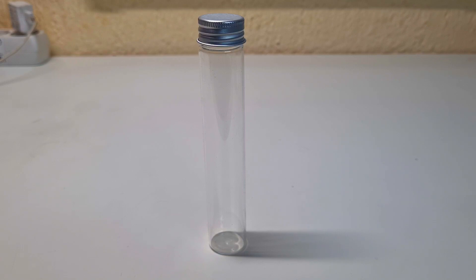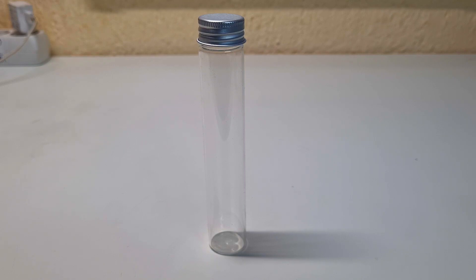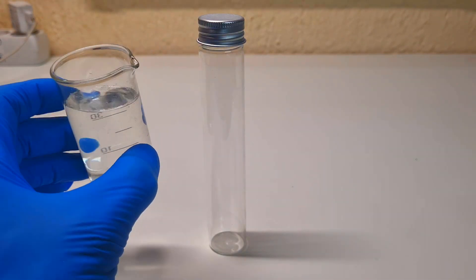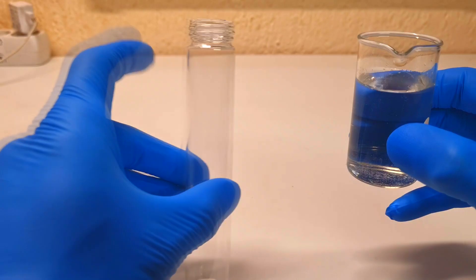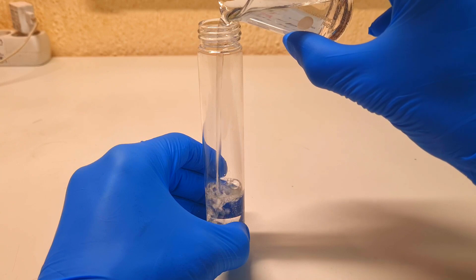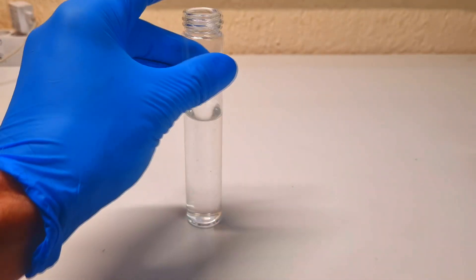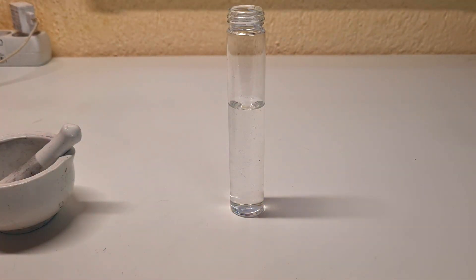For this experiment, first I need to dissolve the iodine. And because the iodine will not dissolve only in water, for this reason I will need to have some solution of potassium iodide. Here I have potassium iodide, which I will put into this test tube. And now I will add some small amount of iodine.